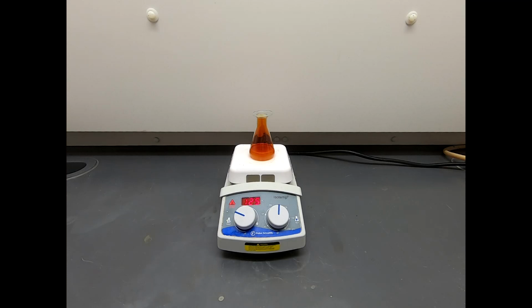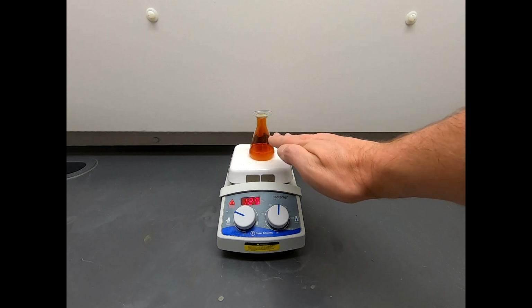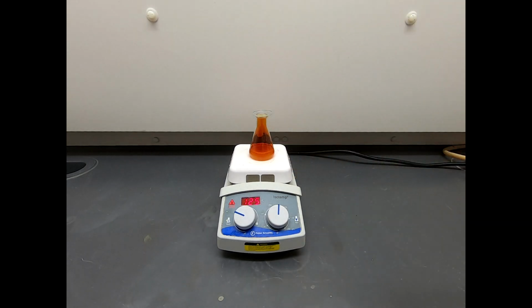And honestly, the reaction looks kind of the same at the moment. And right now we're probably about 35 minutes in. So I'm going to go ahead and run another TLC plate, and we'll see what happens. Okay, we're about 30 to 35 minutes in, and I think this does look a little fainter in the coloration. So maybe that's a sign that we're getting some progress, but based on the TLC, it's still going. So let's go ahead and take another TLC, get that third TLC plate, and just see where the reaction's at.